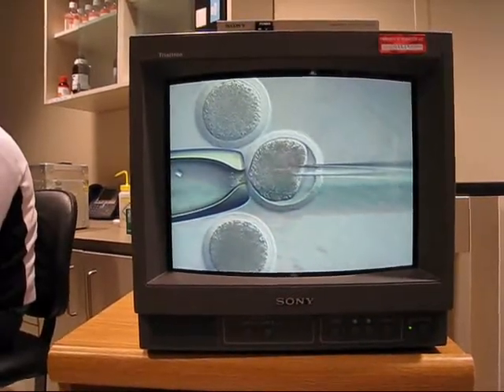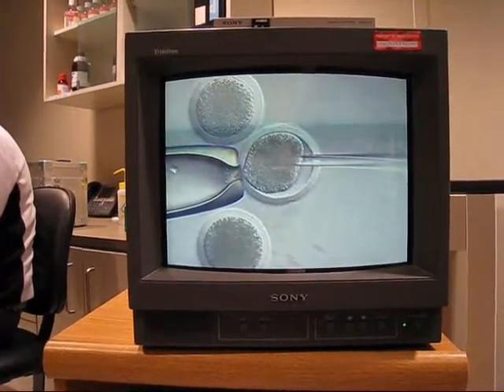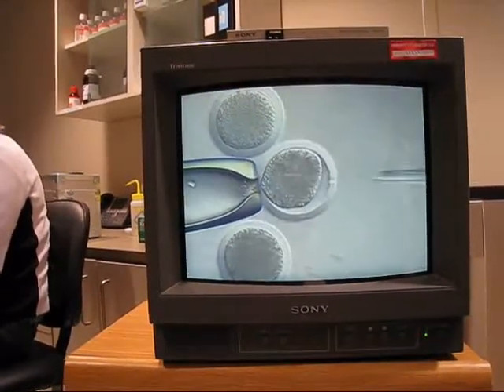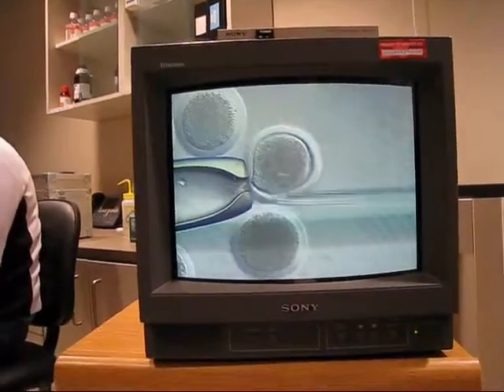See if it can figure out where it's at. Keep going, counterclockwise. That'll be a two-headed cow. Two-headed cow. There you go. Nice. Yay! That'd be funny. Nice job.